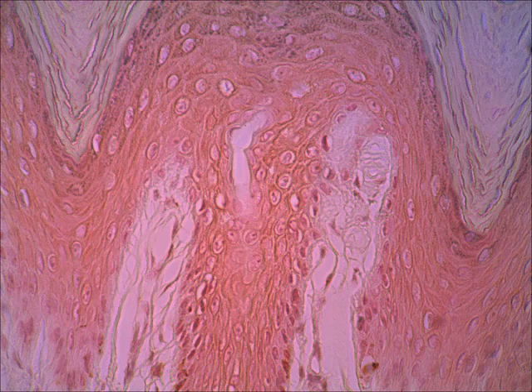There it is. All right, I bet you can pick out the Meissner's corpuscle. Look in the lightened area where the dermis projects up towards the darker epidermis. That would be a dermal papilla. See, here's a dermal papilla, here's a dermal papilla, but within this second dermal papilla right there is a Meissner's corpuscle. So do you see what I mean by swirly, or it just looks swirled or whirled? That's a real good view of a Meissner's corpuscle. Remember, these are sitting up high in the dermis. Because of their location, they can be sensitive to just light touch and texture.